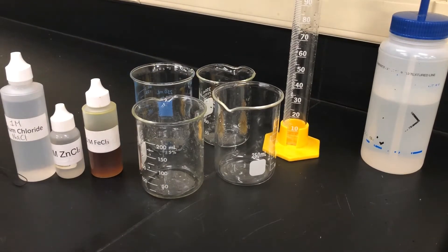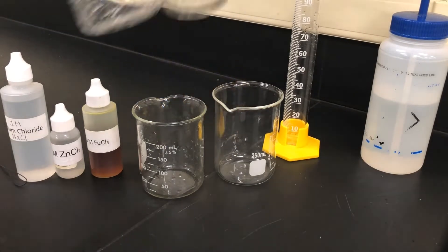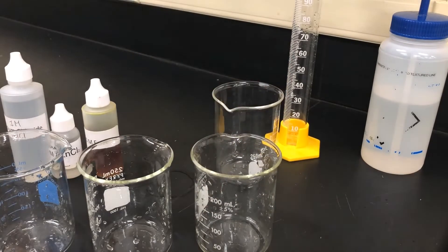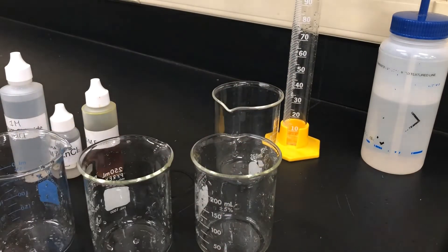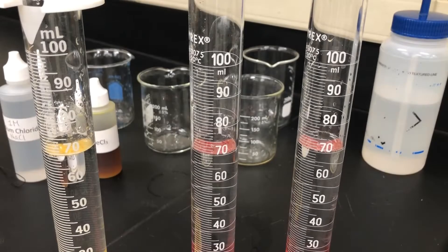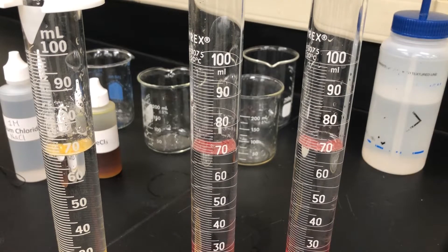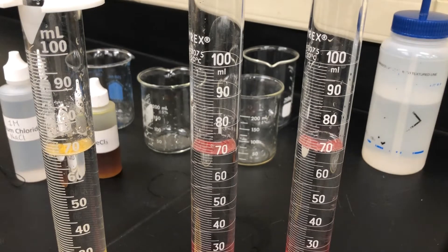The first step is to use three beakers rinsed with deionized water and we are going to measure 70 milliliters of deionized water and put them in each of these three beakers. Here we have three graduated cylinders each with 70 milliliters of deionized water that we're going to use in our experiment.